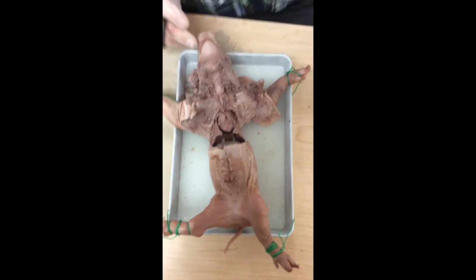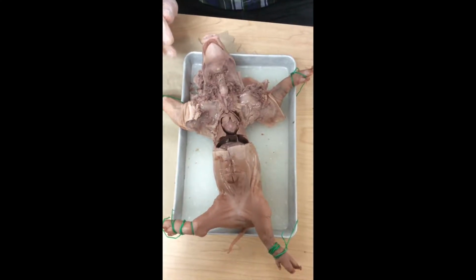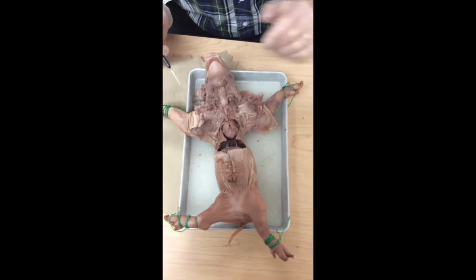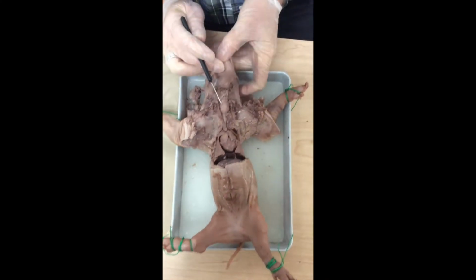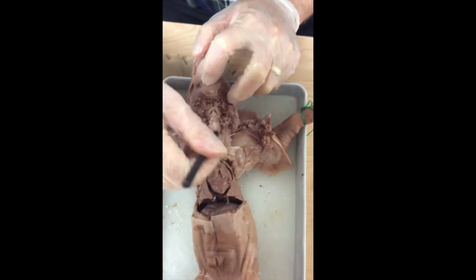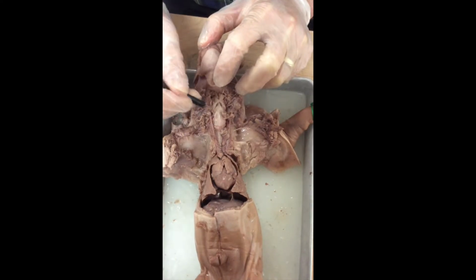Going right now. Okay guys, I want to give you some review instruction of parts that we've already looked at, and then we'll take you into the next phases of the dissection. We've got the throat area all opened up here. Now, fourth block, I don't think I got to you with this instruction.